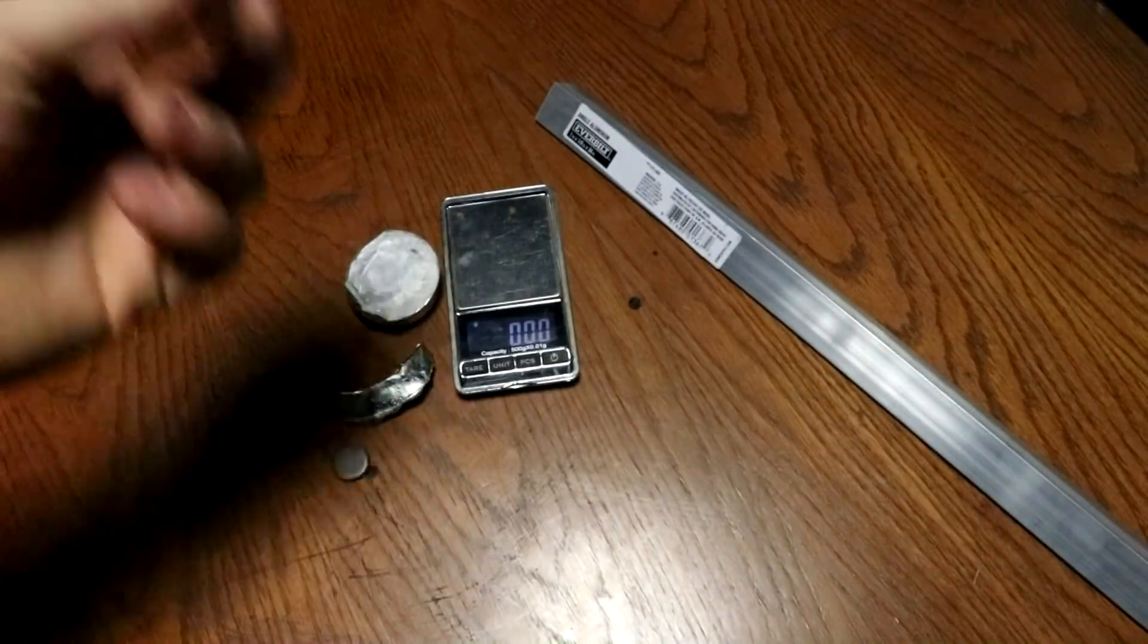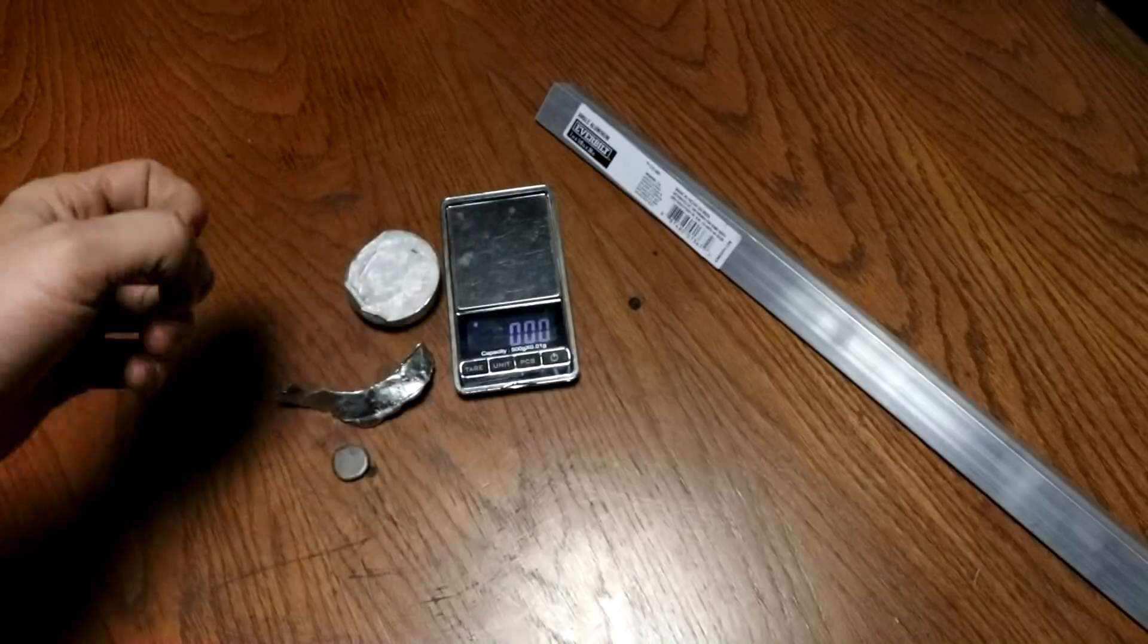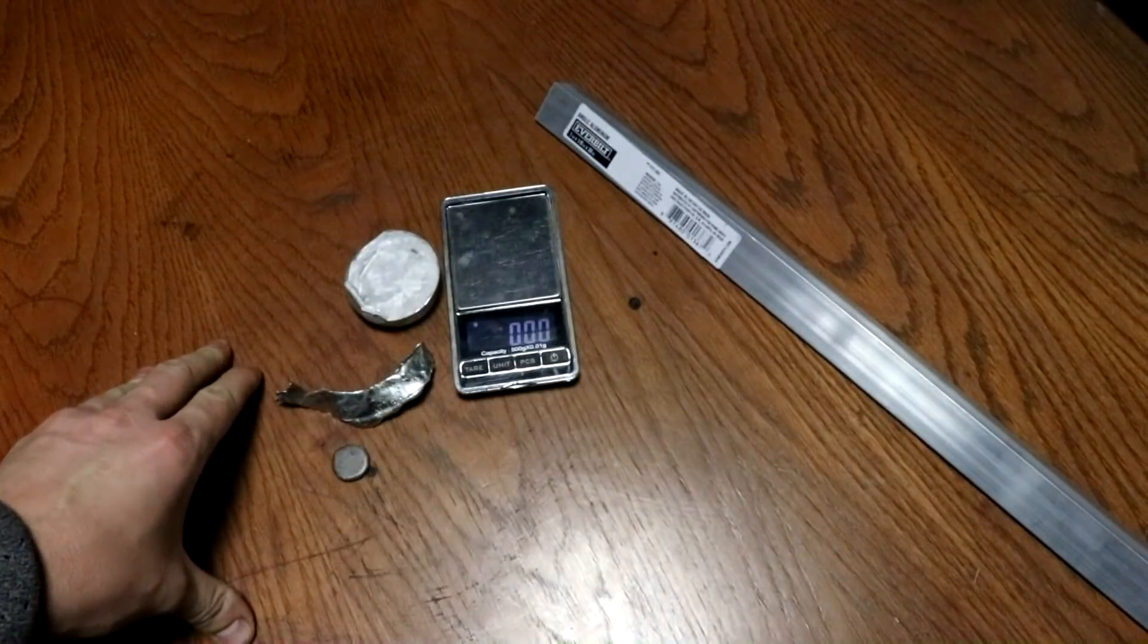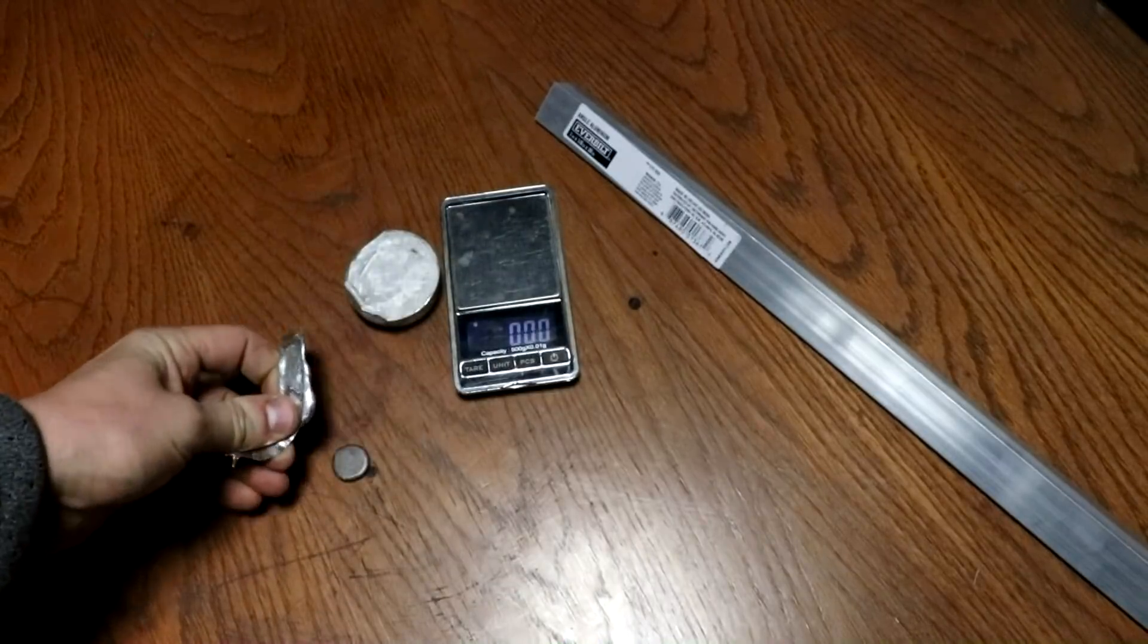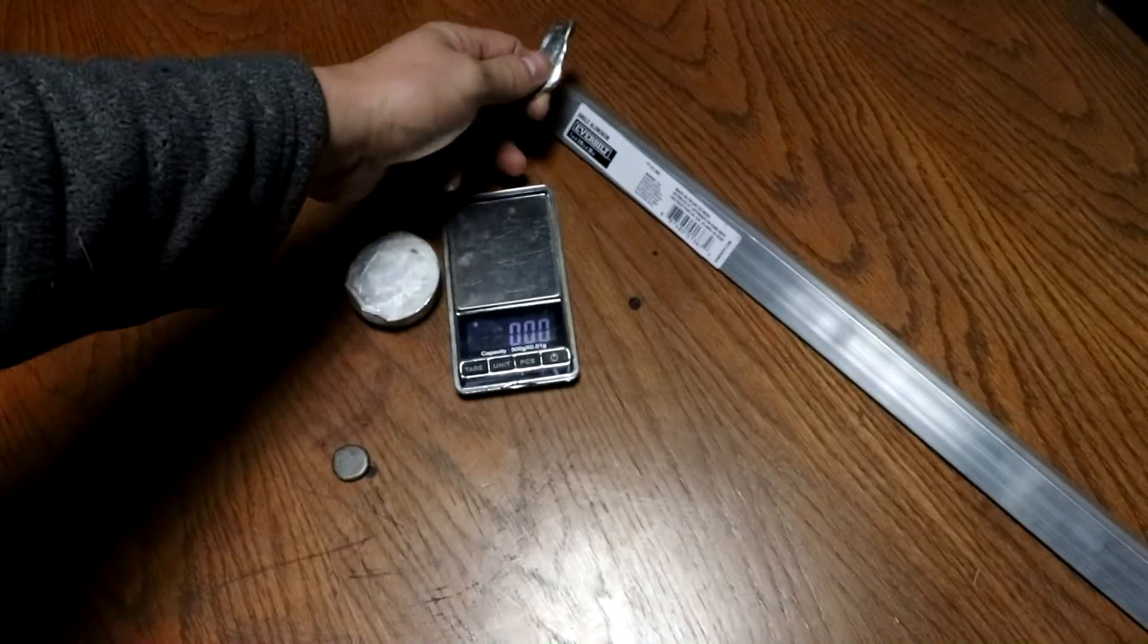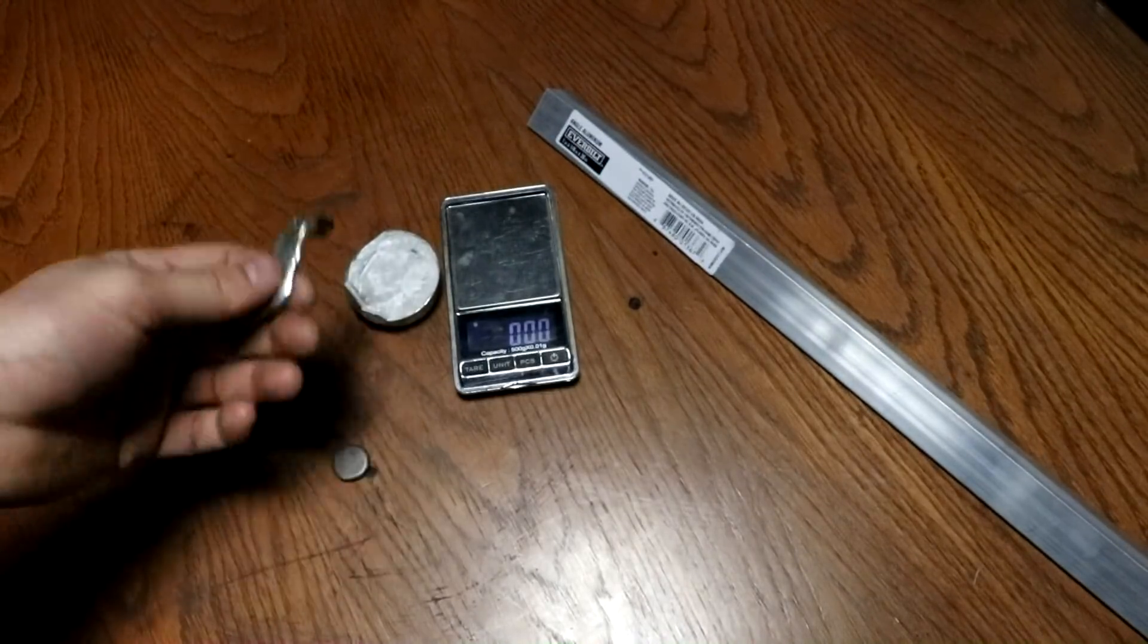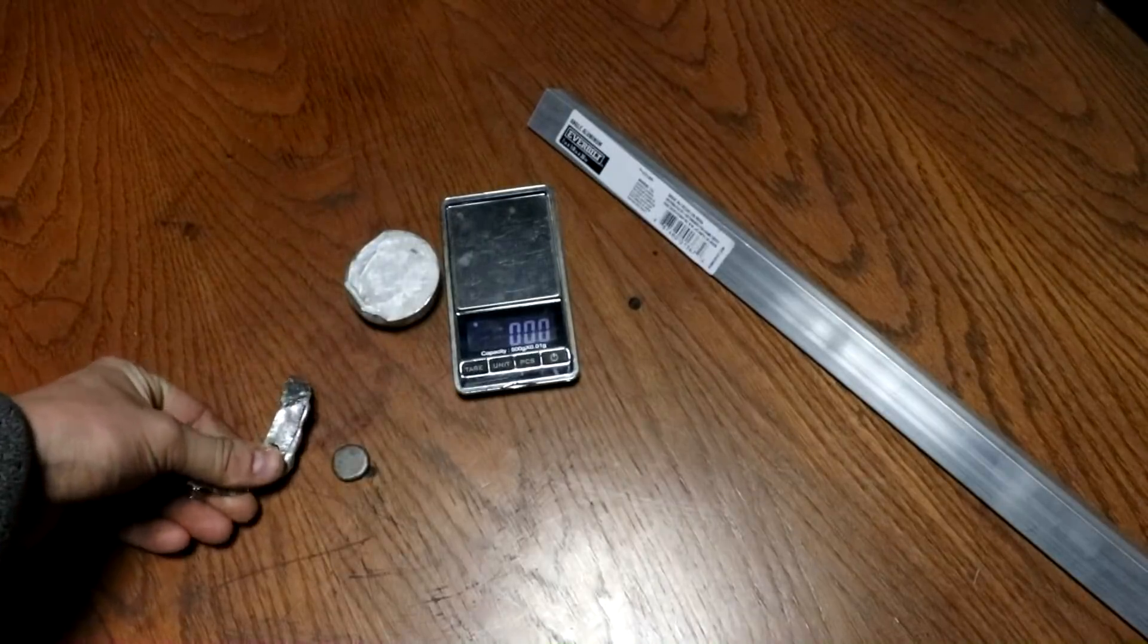You might have seen mercury destroying aluminum or gallium destroying aluminum. What I have not seen is an alloy which is liquid at a higher temperature also doing it. And I think it should. As long as the metal can dissolve the aluminum, then it should catalytically destroy it, as mercury will.